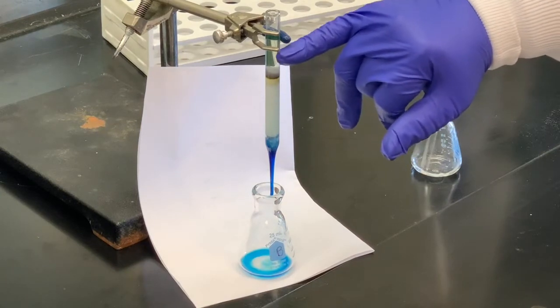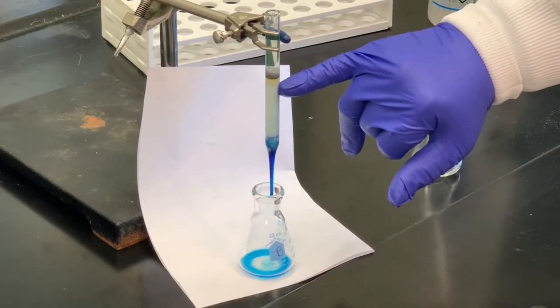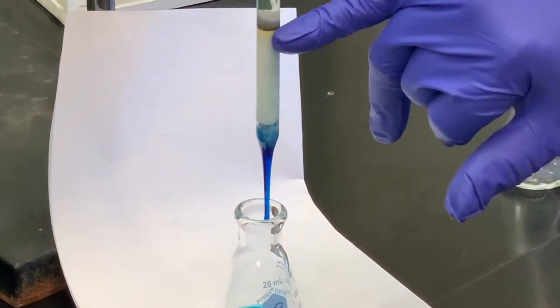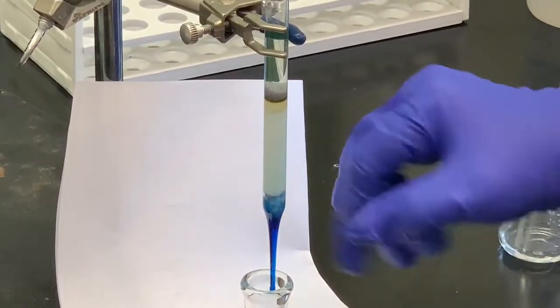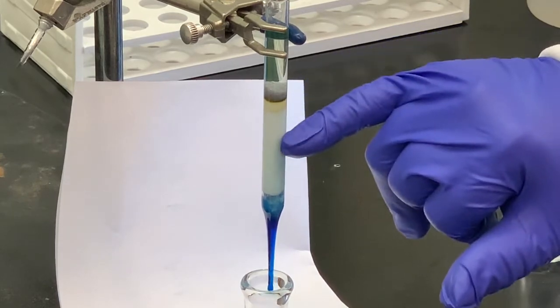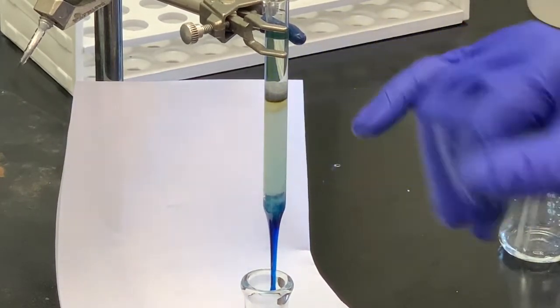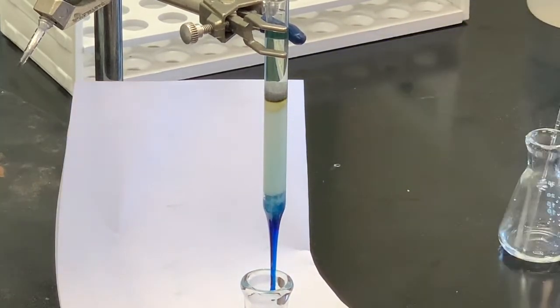As you can see, the water has been flowing through the column and you can see the appearance of a yellow band near the top — that's the fluorescein. We're still recovering some of our methylene blue here. We're going to let this go a little bit longer so that you can see that band. You can certainly see the yellow is now moving — it did not move with the ethanol, but is moving with the water just by changing to a more polar substance.